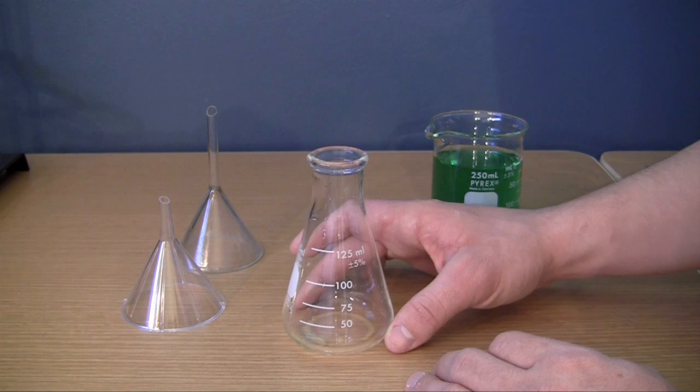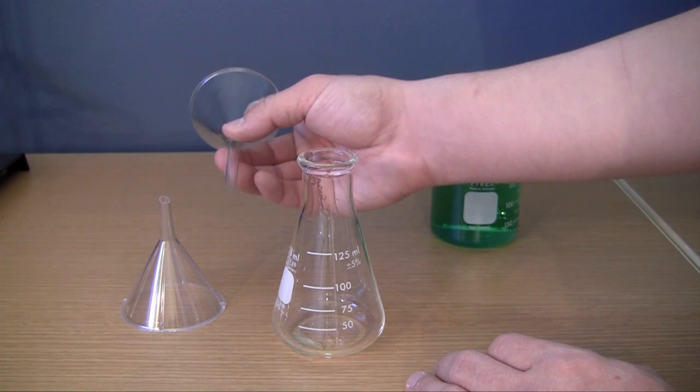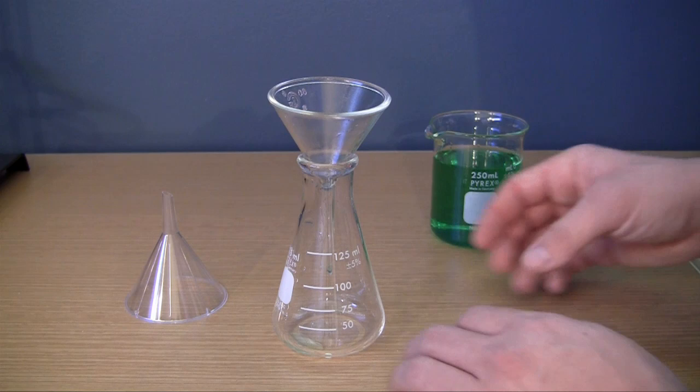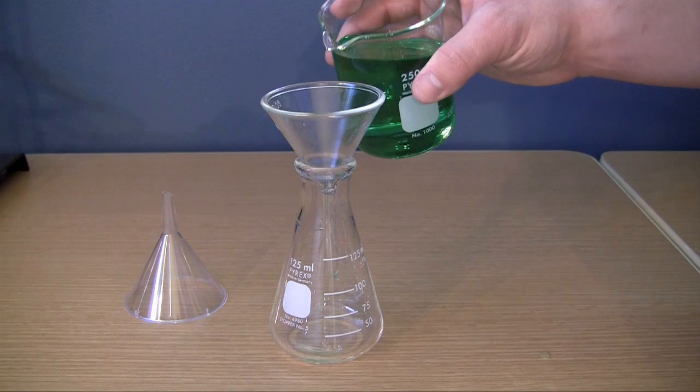So typically whenever people use funnels like this, here I have a glass funnel in my hand and this is just a cheap disposable plastic funnel. What they do is they usually just stick it inside their container like an Erlenmeyer flask and then you start pouring the liquid or solution in.